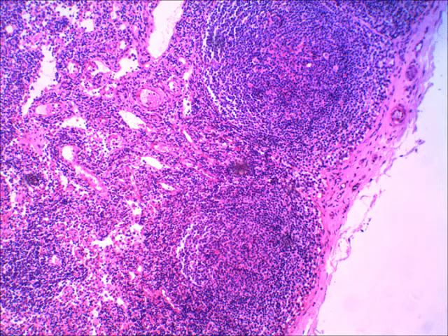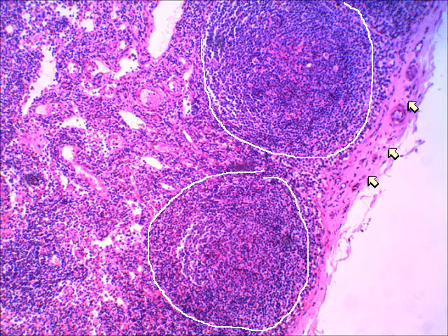There we see it. It's real easy on this picture to see the fibrous capsule, and then, if you will, follow my lines that I'm drawing. Here we go. There you see it in that encircled area. That would be, guess what? That's the lymph nodule right there. Okay, and then all of these other areas, and I'm just zigzagging across, that's the sinuses, the lymph sinuses, and that's what the lymph drains through.